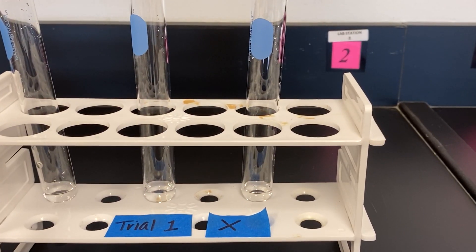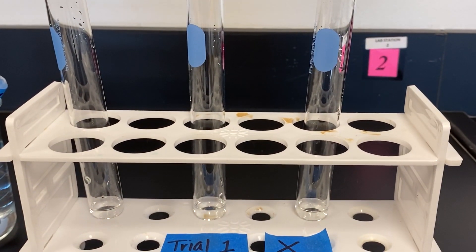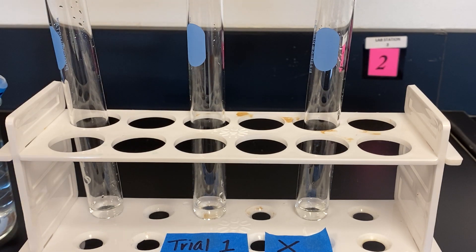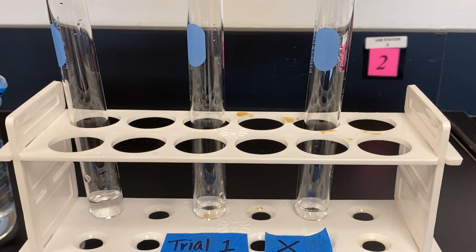Ensure you observe the reactions as they occur when we are adding solutions X, Y and Z to the X solution. So we add X in the first test tube. As you can see there is no reaction.